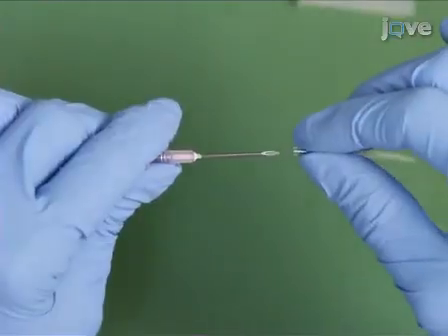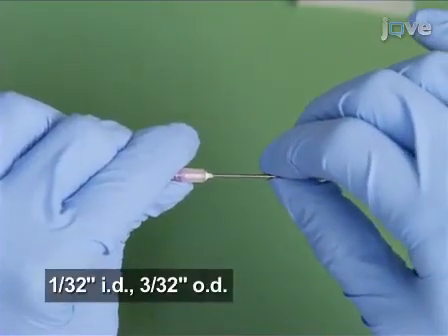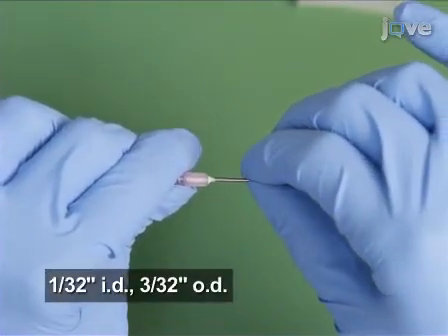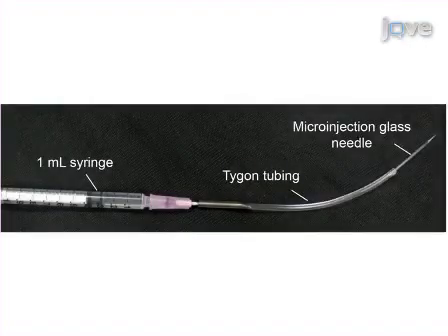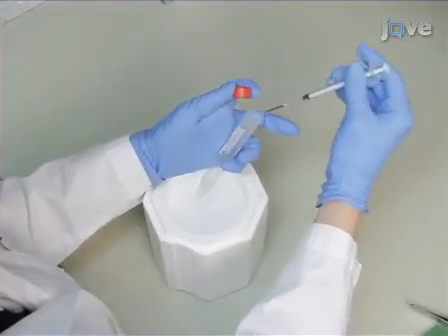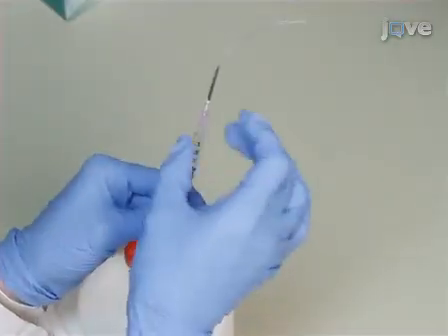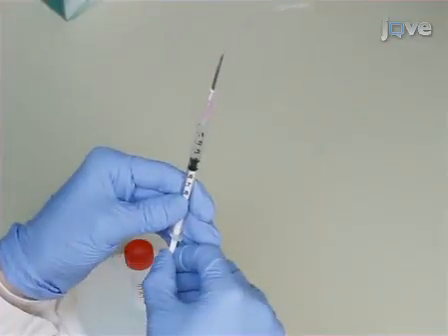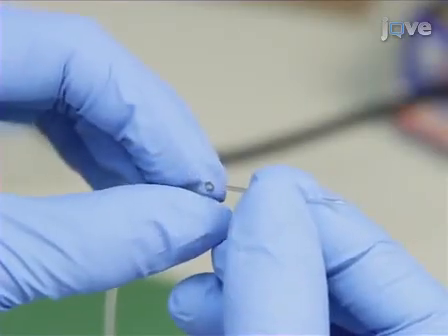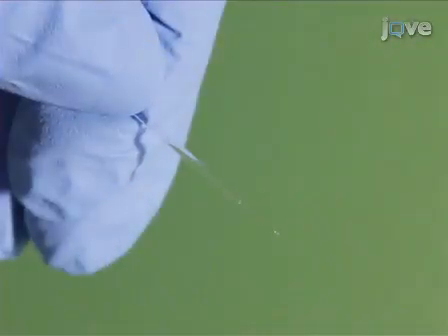Assemble a microinjector by connecting an 18-gauge needle to a 1 milliliter syringe with a 5 to 6 inch piece of Tygon tubing. Carefully insert the bevel of the needle into the tubing. Approximately 4 to 5 inches of tubing should extend from the tip of the needle. Now, draw the tumor cell suspension through the tubing into the syringe and invert. Carefully tap the side of the syringe and depress the plunger to remove any air bubbles. Next, insert a microinjection glass needle at the end of the tubing and depress the plunger until the cell suspension reaches the tip of the needle.